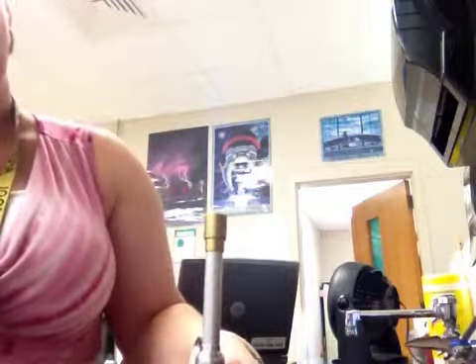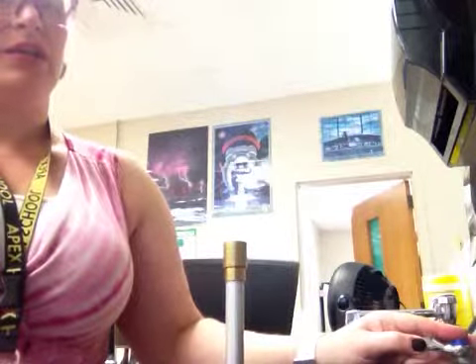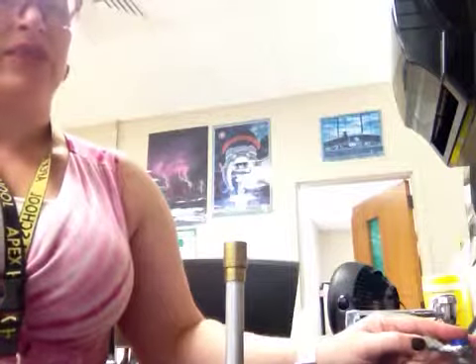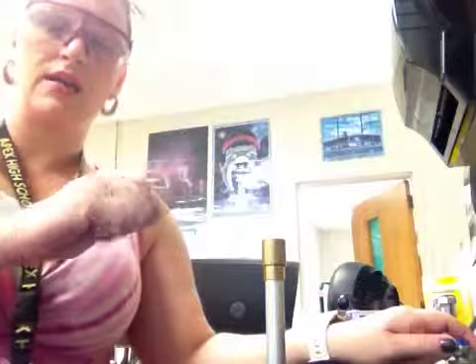It's still a little bit tall. The higher the flame, the less concentrated the heat. So let's adjust the quantity of gas that's going in so we get a nice, manageable flame. There we go. The hottest part of the flame is just on the inside in the middle, so that's the part I'm going to use.